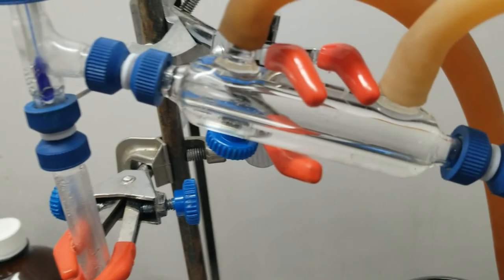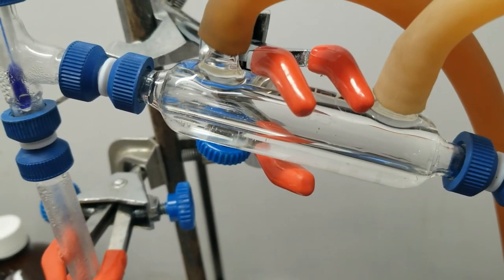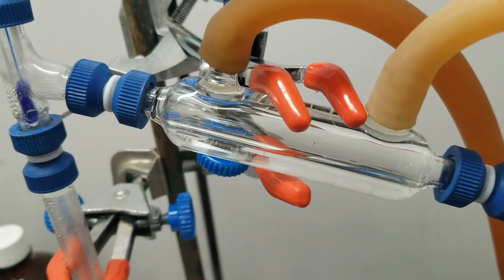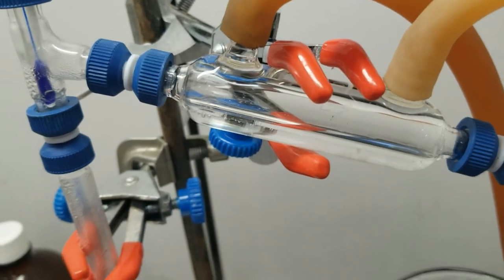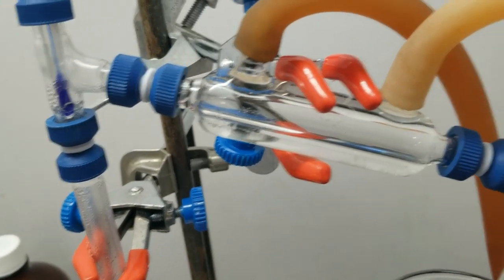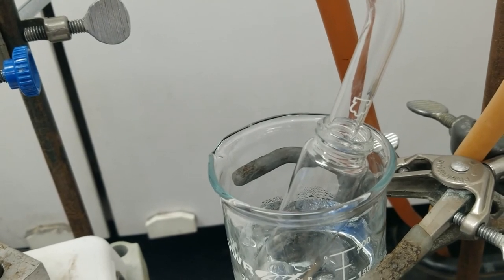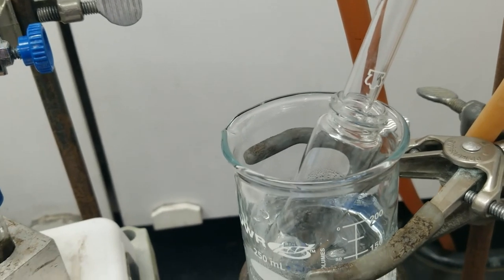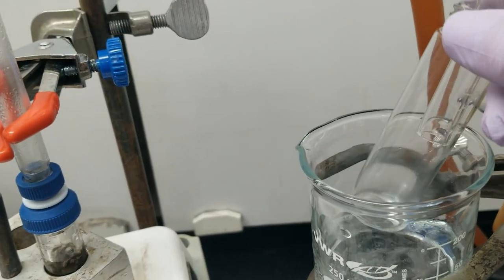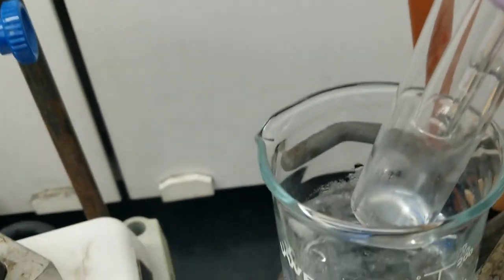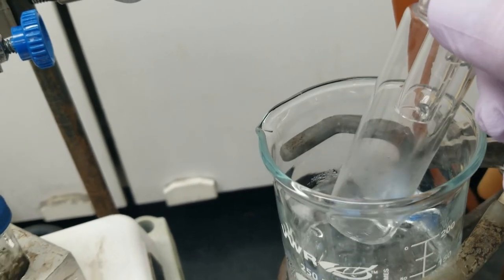So let's see if I can get this to focus well enough to see it. We have drips of cyclohexene which are collecting in our water jacket and condenser which has water running through the outside tube here. And then we have drips of cyclohexene which are being collected in our cold collection flask here. And so far we have maybe a milliliter of cyclohexene collected.